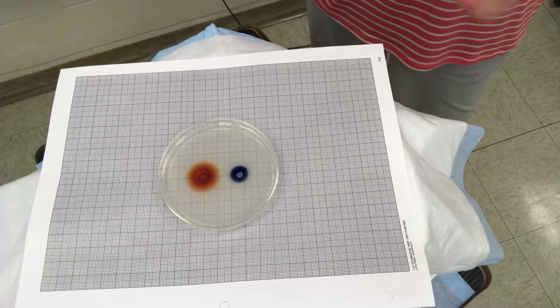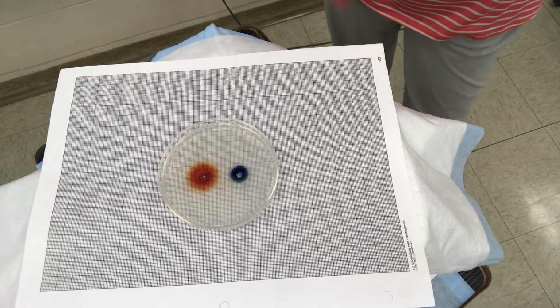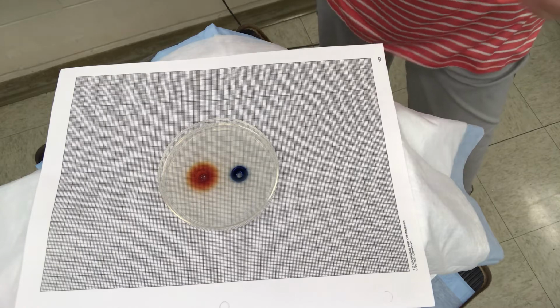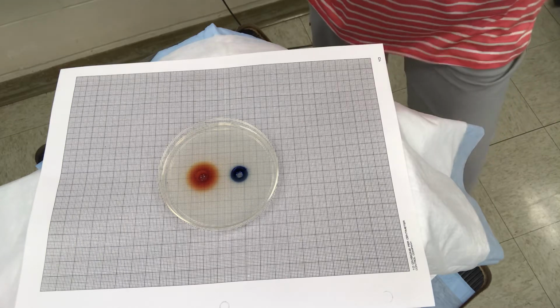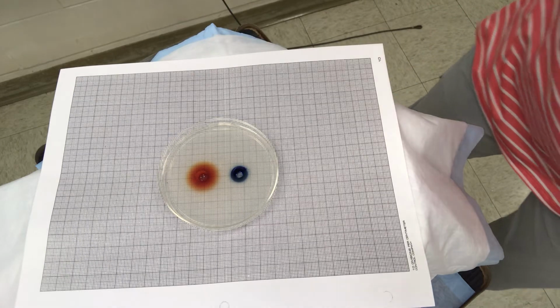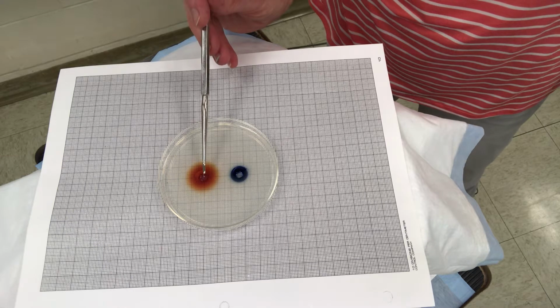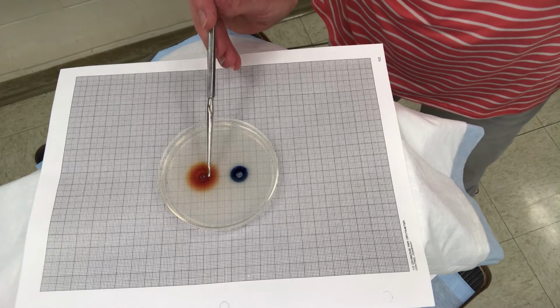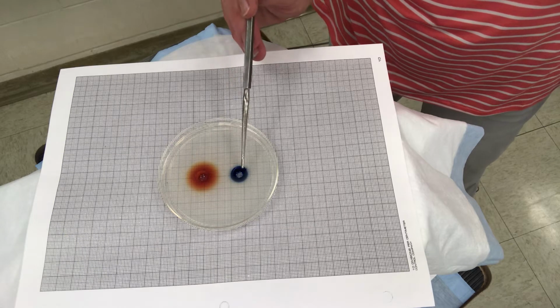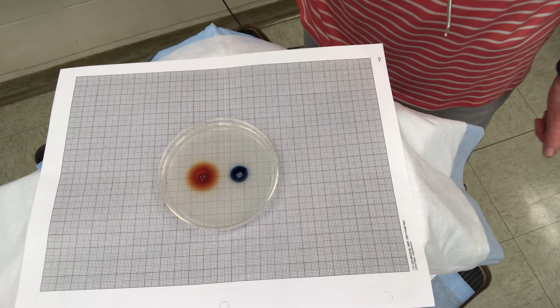We've started them at the same exact time, and we have measured the diffusion in 15-minute intervals over a 60-minute period. And just visually, you can see that the potassium permanganate has moved much farther than the methylene blue during that time period. You want to measure it from the edge of the well out. So you can see it's moved about 10 millimeters or so, whereas the methylene blue has maybe gone about 3 millimeters during that same time period.